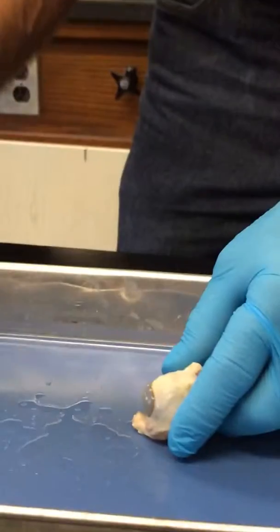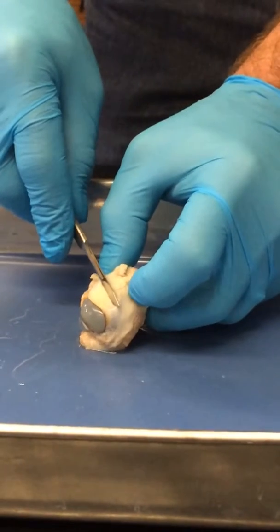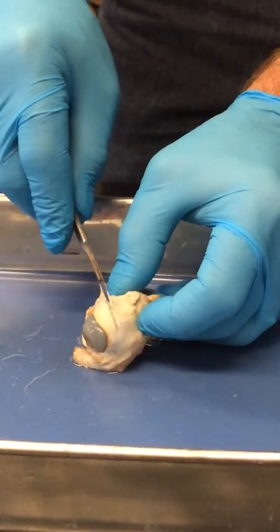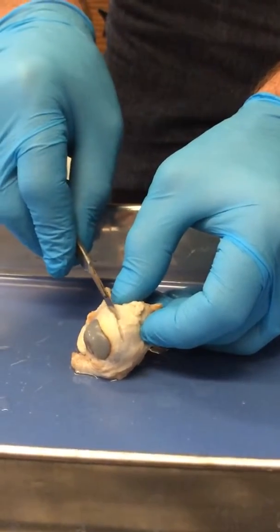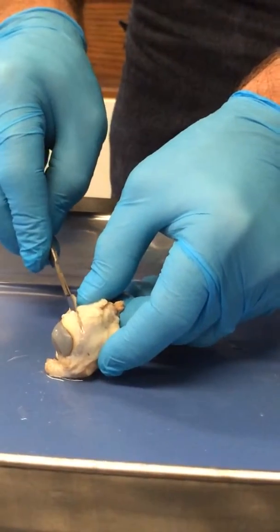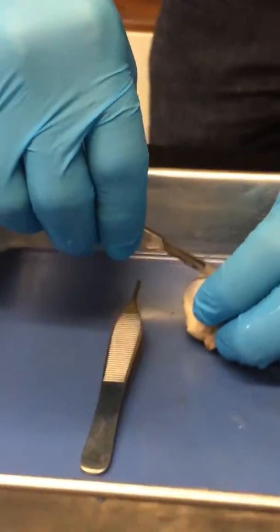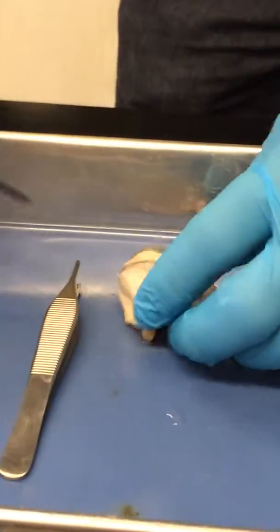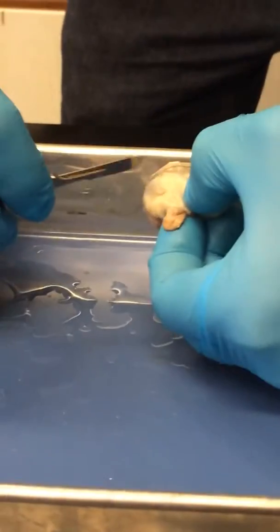So I'm just going to do this now, and I'm going to section the anterior half from the posterior half, and I'm going to do this kind of gently because I don't want to be pushing on this, because what's inside of the eye? There are humors, right? And in the anterior portion of the eye we have one of the humors. The aqueous humor is in the anterior portion, and in the posterior portion of the eye you have the other, the vitreous humor, right?